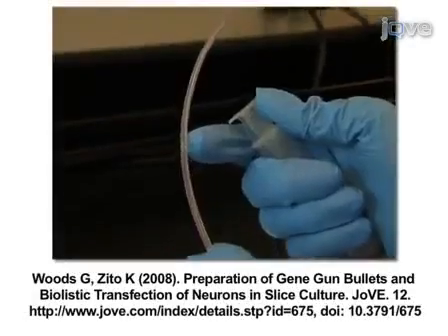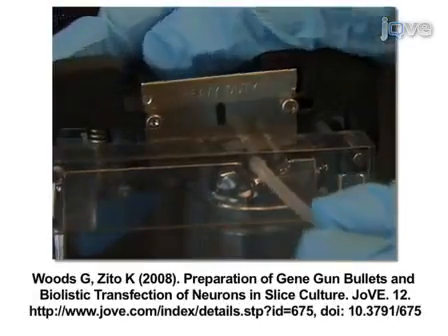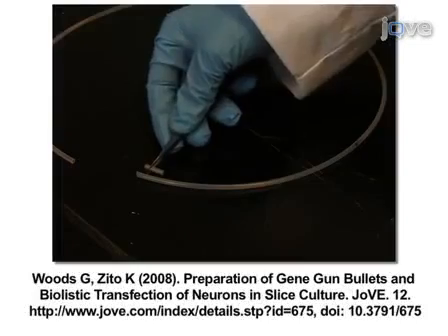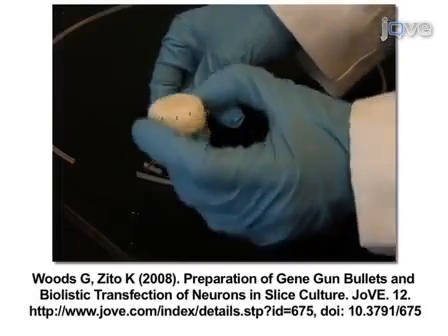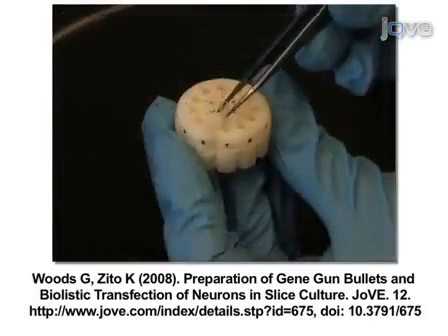To begin this procedure, prepare cartridges for the Helios gene gun following the JoVE video protocol by Woods and Zito 2008 that demonstrates in detail the cartridge preparation procedure.